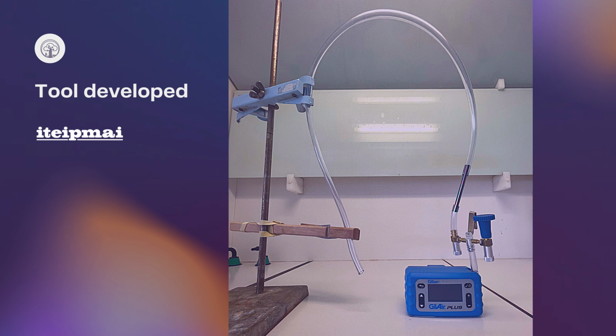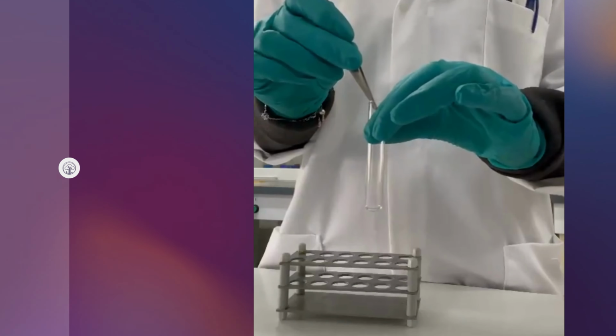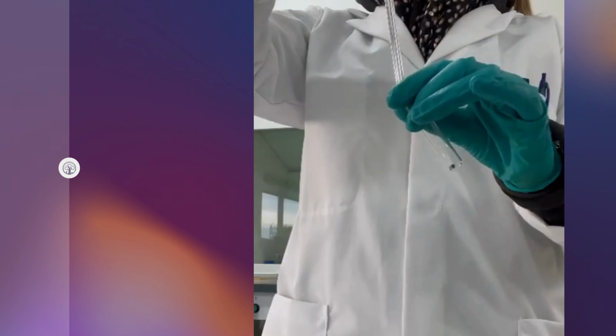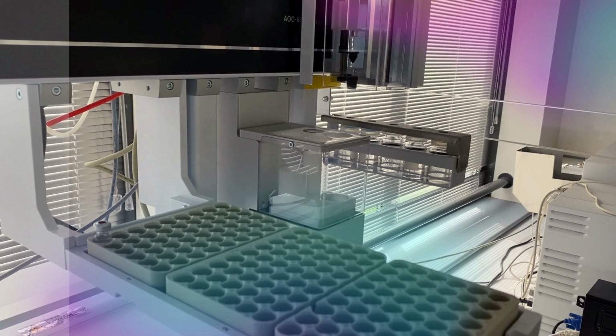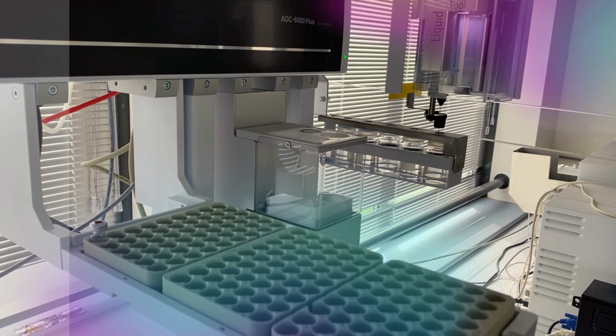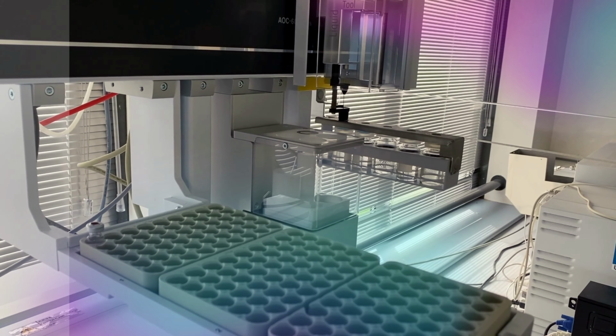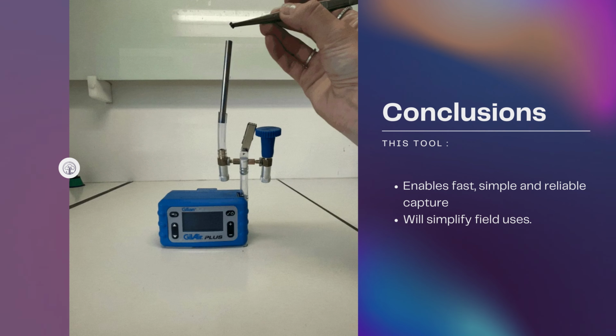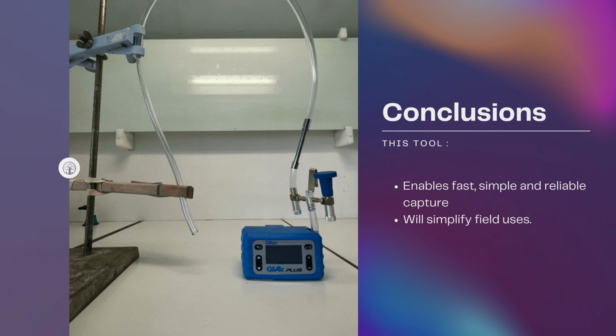The tool, developed by Iteipmai, includes a pump, a metal liner, a solid support, and a pipe that traps VOCs in the atmosphere. Following this capture, the solid support is recovered in order to extract the VOCs. The extract is then run through various gas chromatography equipment to identify and quantify the captured VOCs. This tool enables fast, simple and reliable capture. Its small size and lightweight make it easy to use in the field.